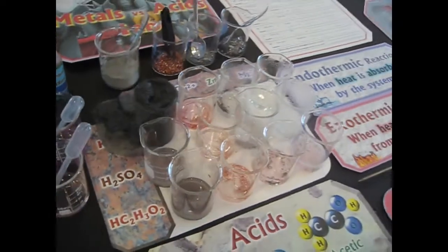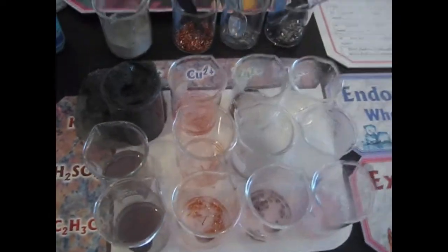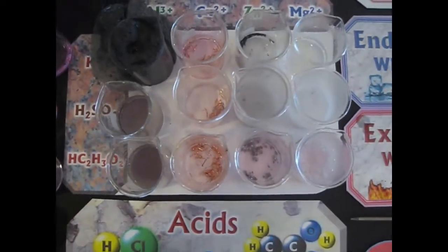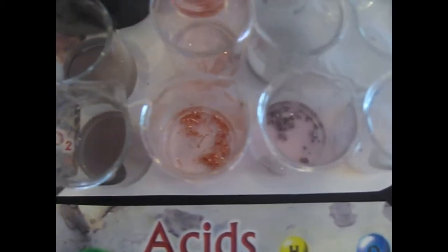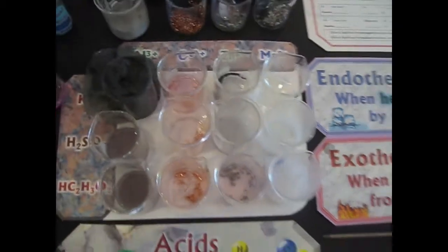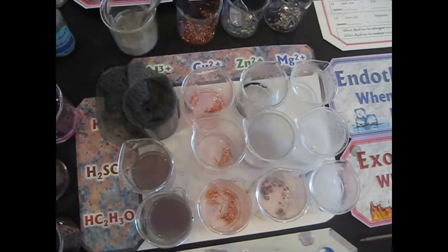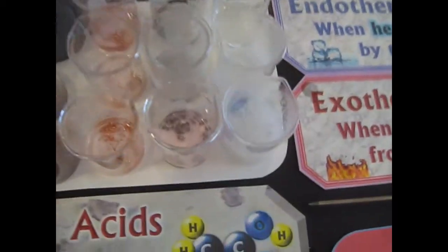You don't ever want to be right above these. I was going a little bit too high above them just to get the right shot, but I can actually move the camera. Here we go. So notice that metals have different amounts of what we call activity, how quickly they react, and so do acids. So certain combinations react more than others.